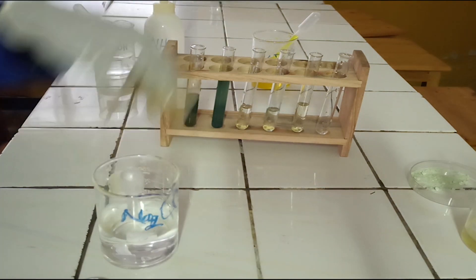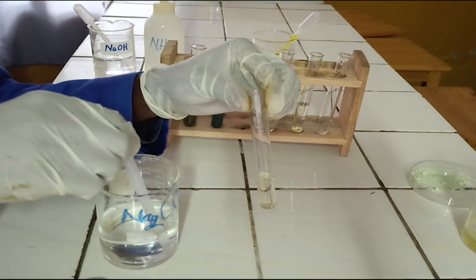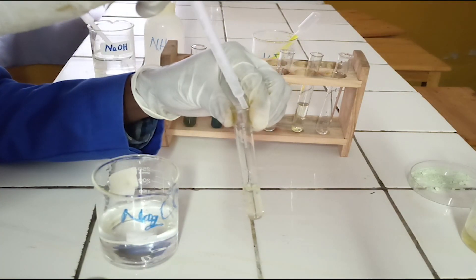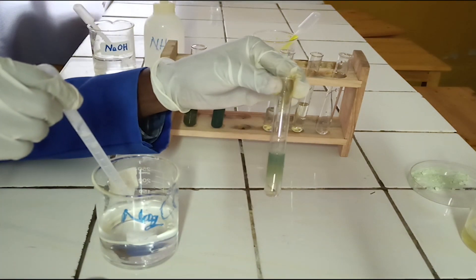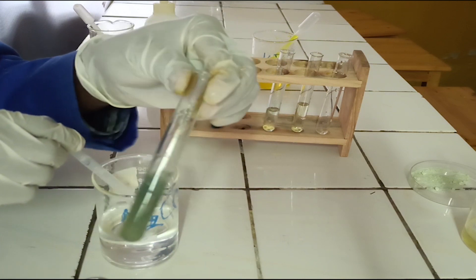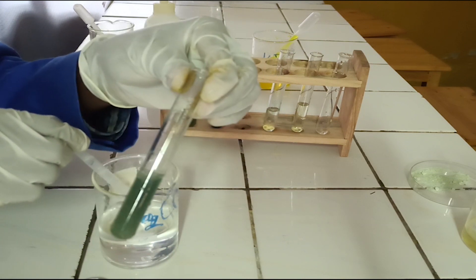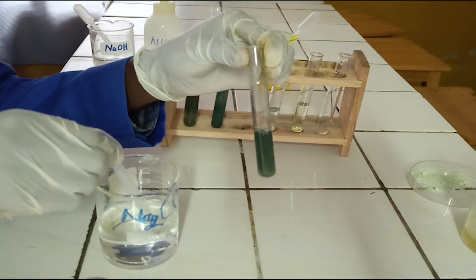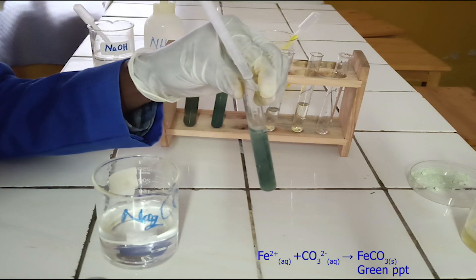To the third test tube, add sodium carbonate solution dropwise until in excess. As you see, sodium carbonate reacts with iron(II) ion to form a green precipitate, which is insoluble in excess of sodium carbonate.